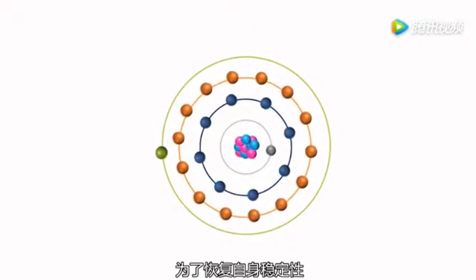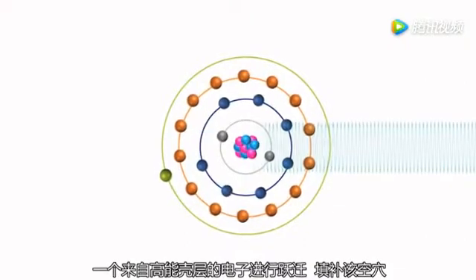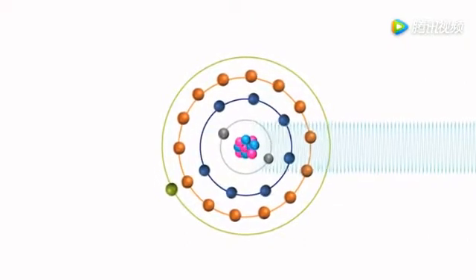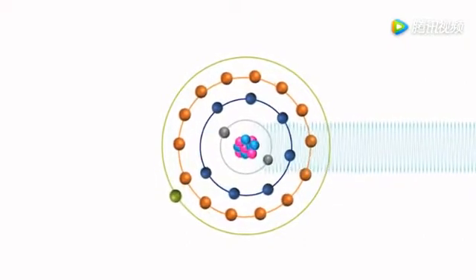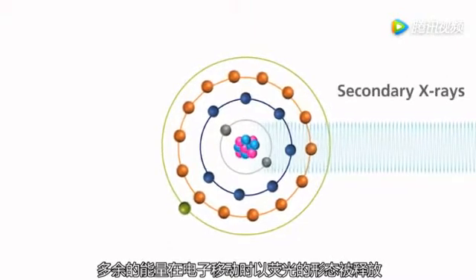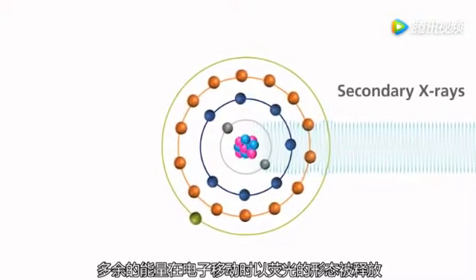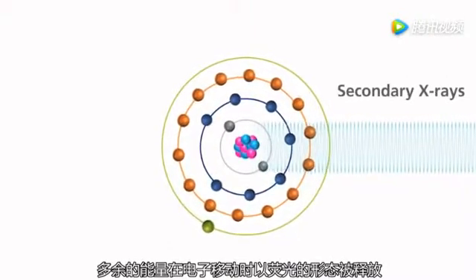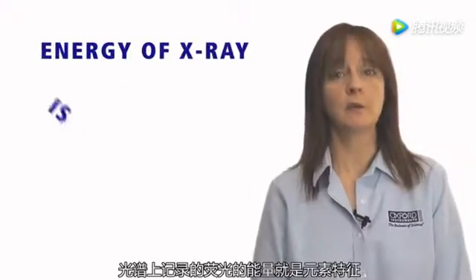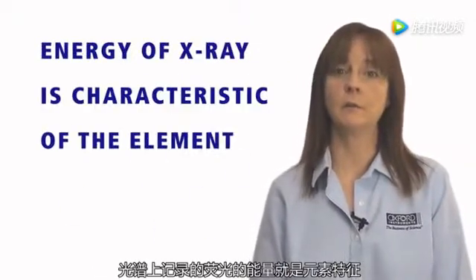To restore stability, an electron from a higher energy level falls into this vacancy. The excess energy released as the electron moves between the two levels is emitted in the form of a secondary X-ray. The energy of the emitted X-ray is characteristic of the element.